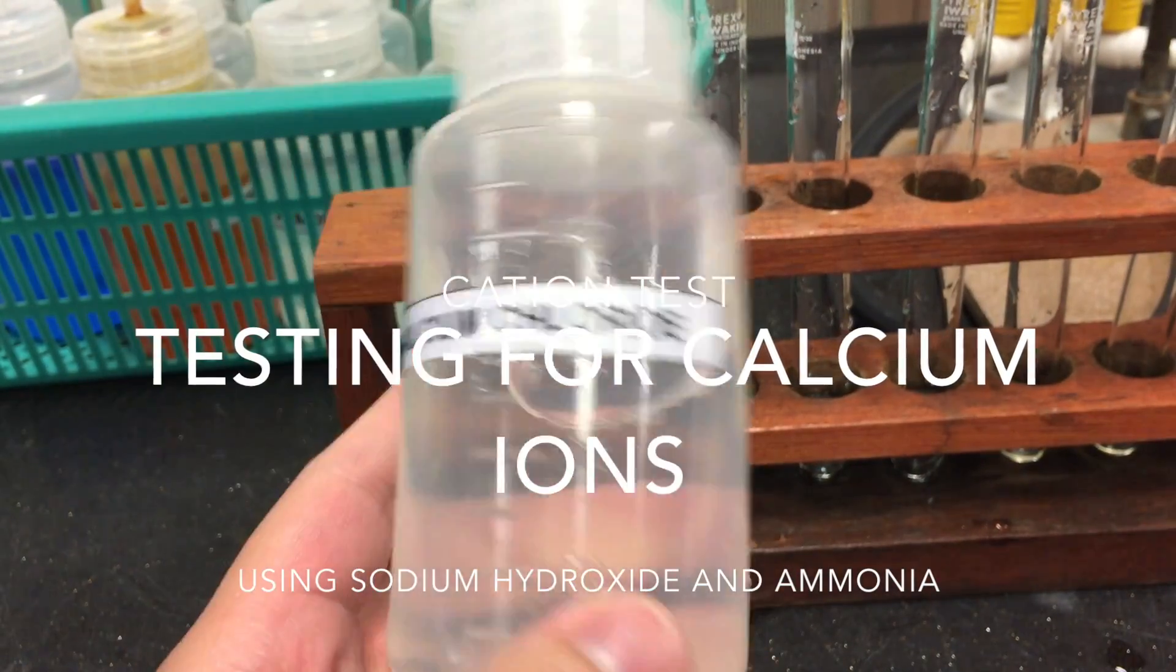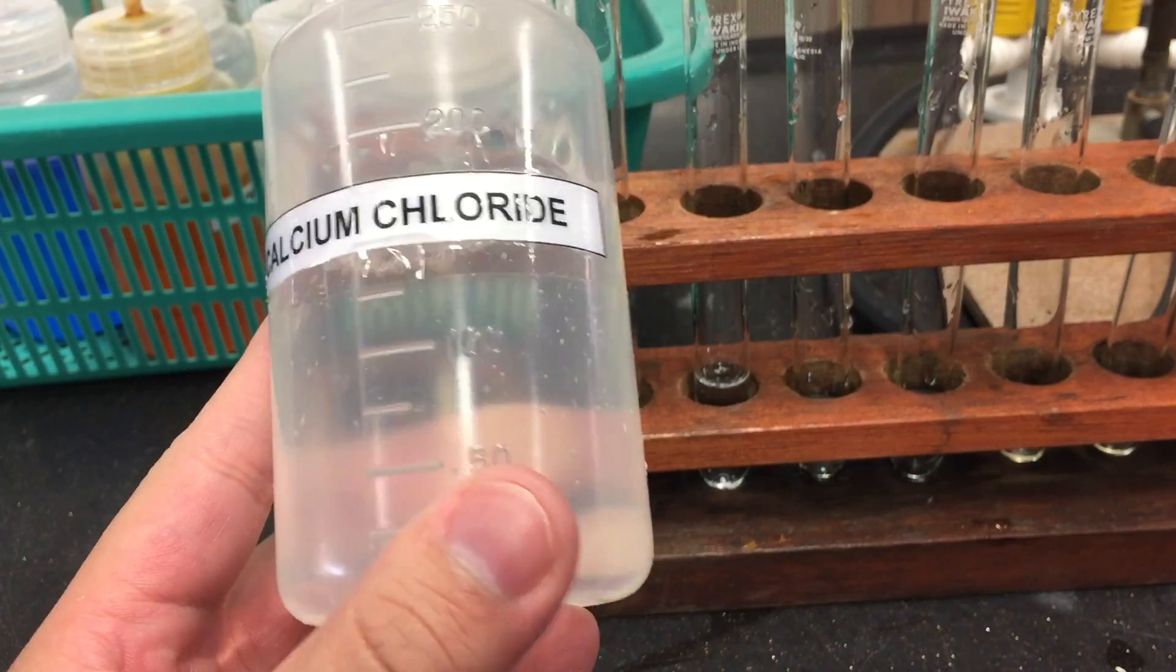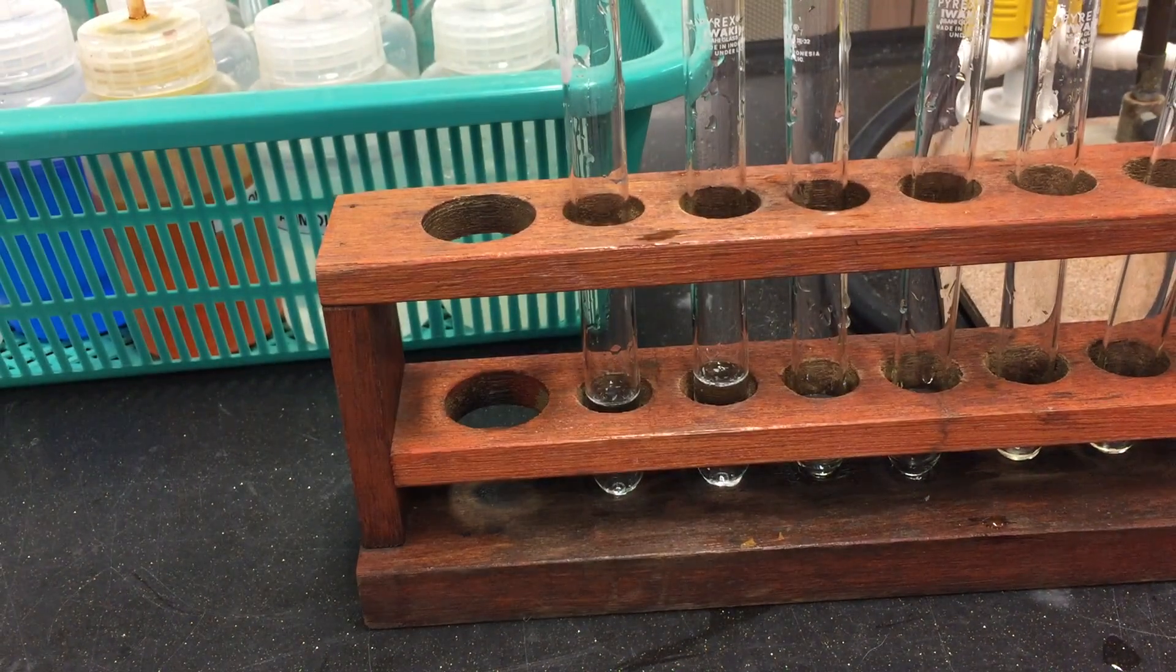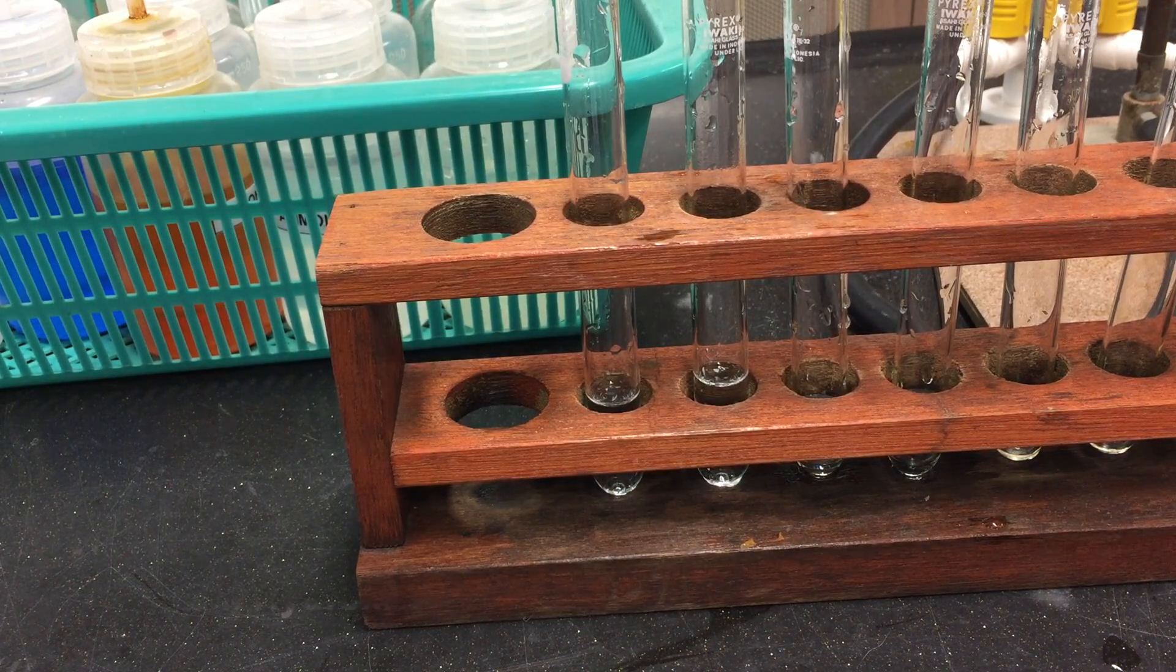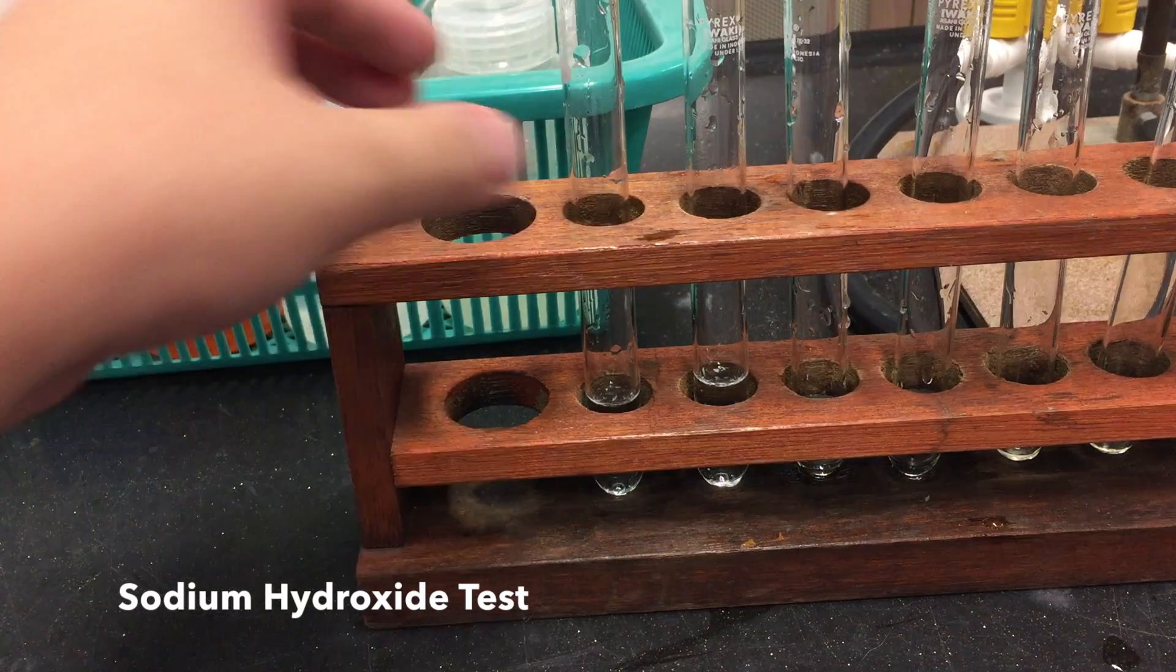Solutions containing calcium ions are usually colorless. To test for the presence of calcium ions, we may employ the sodium hydroxide test.